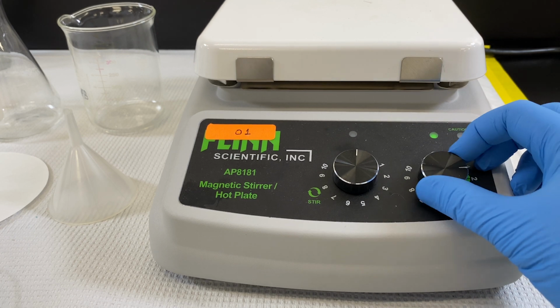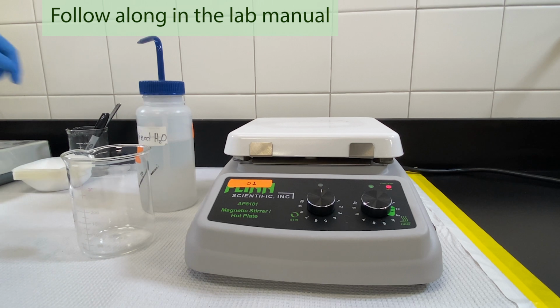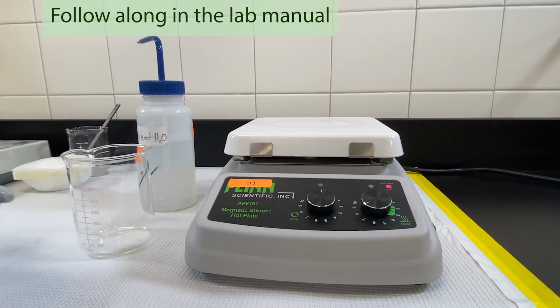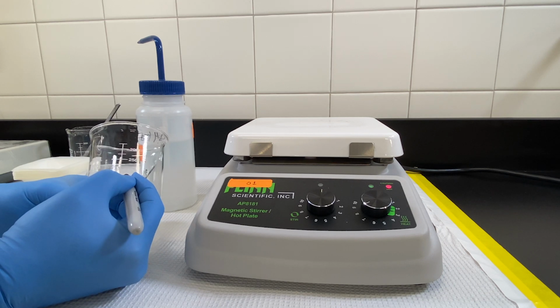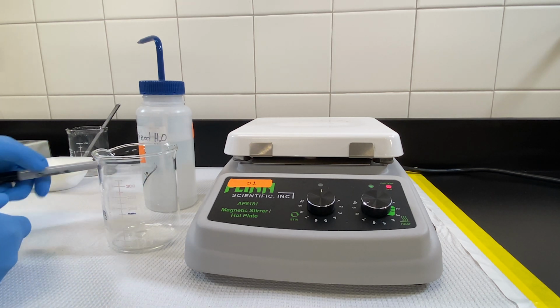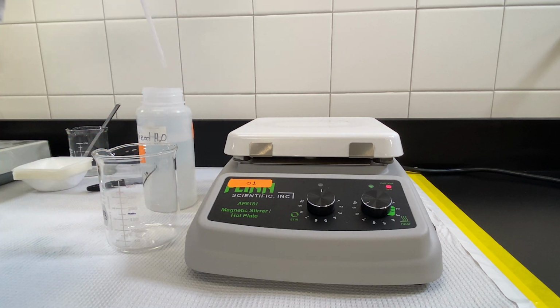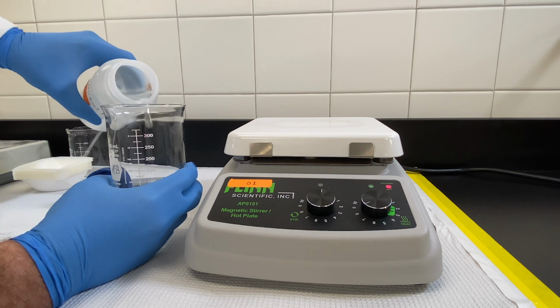First, let's look at the basic setup, being sure to follow each step in the lab manual as we move along. Initially, we're going to heat up some water. We put a mark on the beaker just so it'll be easy to fill it to the right mark.